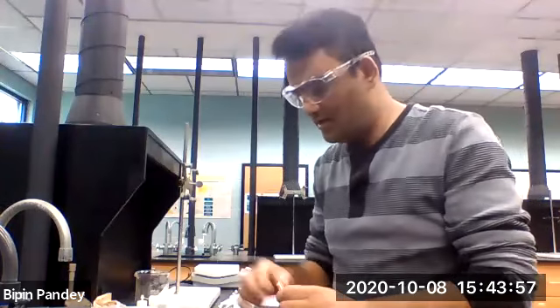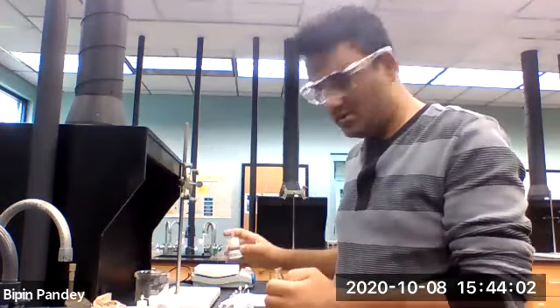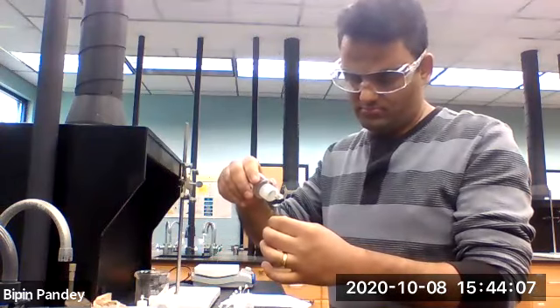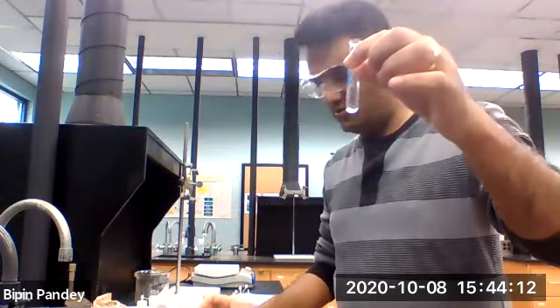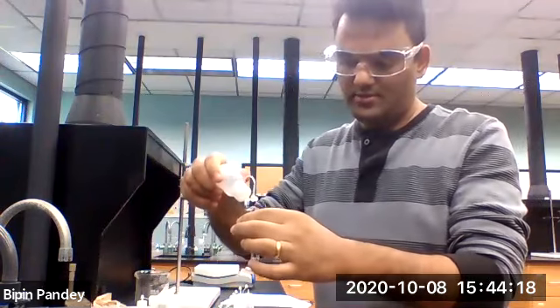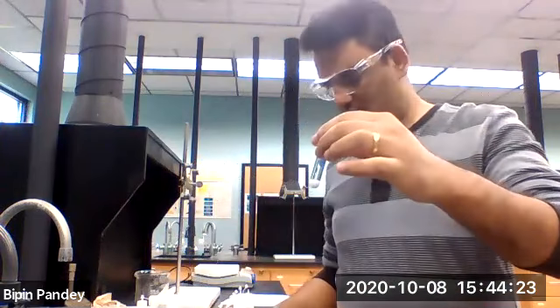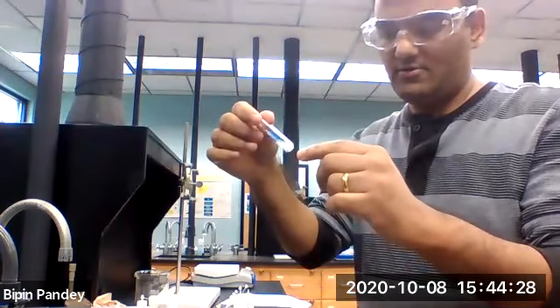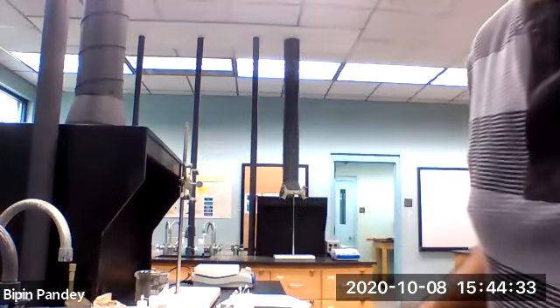All right, so next we are going to see the reaction of silver nitrate with all of these anions. So silver nitrate appears clear to me. So add chloride to it. I see a white solid form. So that's the silver chloride. It does not dissolve, insoluble. So there's a white precipitate.